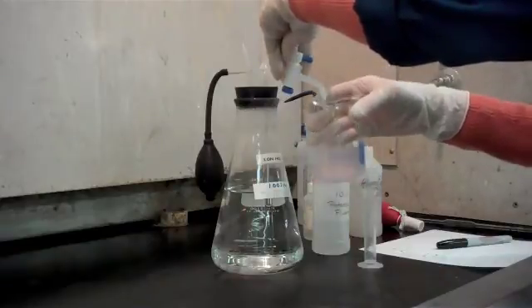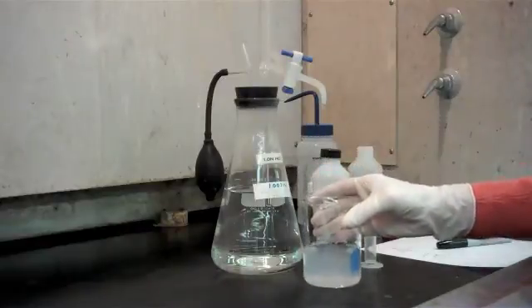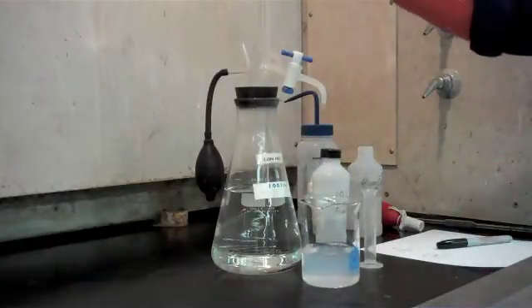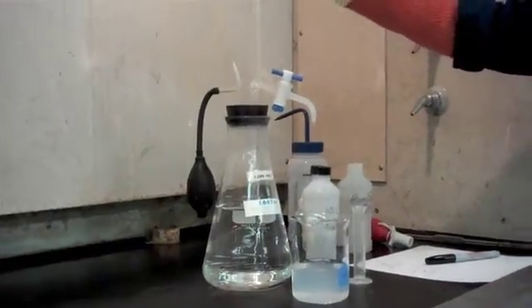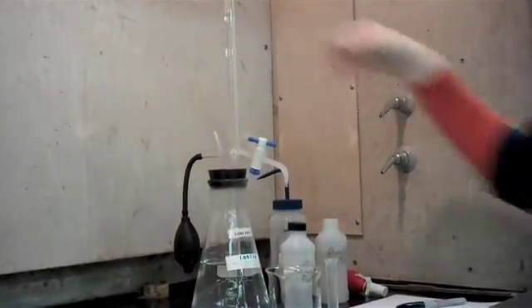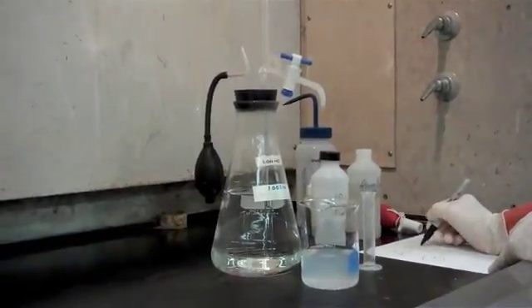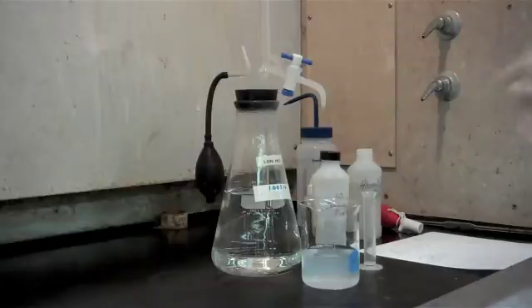And just another drop or so, and we'll see that our pink color disappeared. We're going to read our burette and record how many mils of the one normal hydrochloric acid we used. In this case we used 7.3 mils. So I'm going to just jot that down so we have it for when we're finished with our next titration.